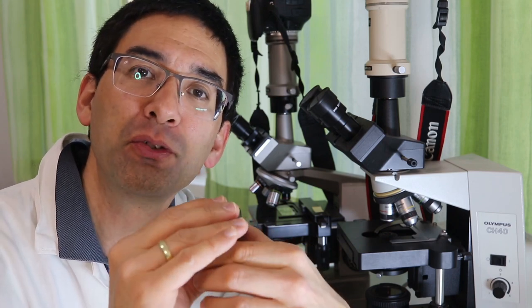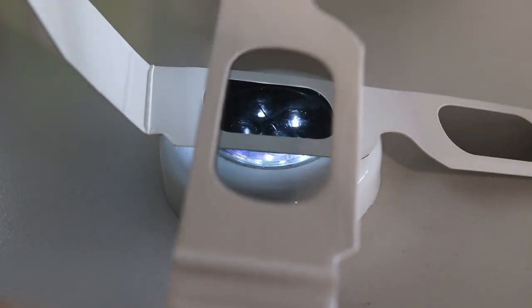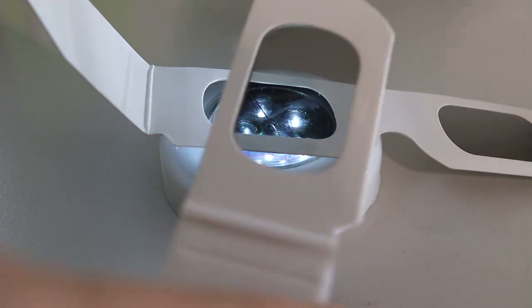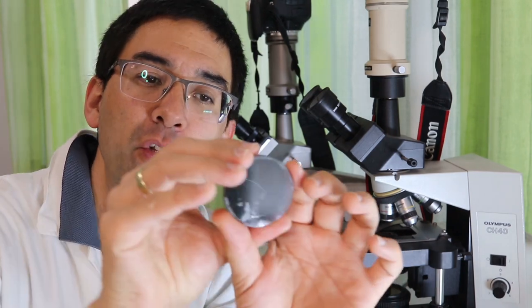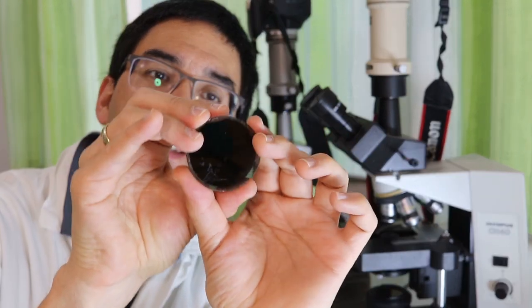It's also possible to use certain 3D polarizing glasses, those made of cardboard. Not all of them work, but some of them actually also use filters when you basically overlap them like this that they become completely dark. So that is basically what we'll be doing right now.